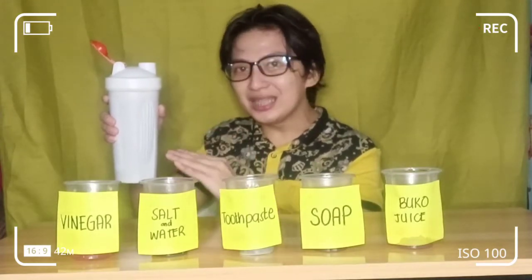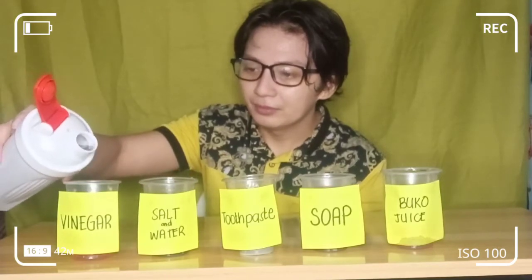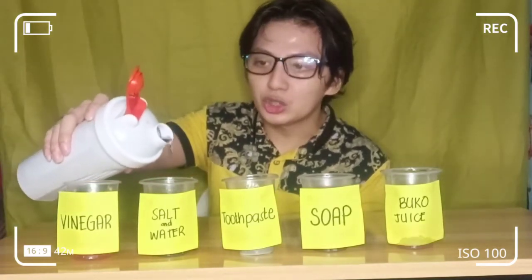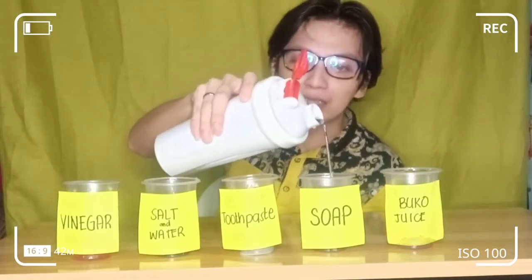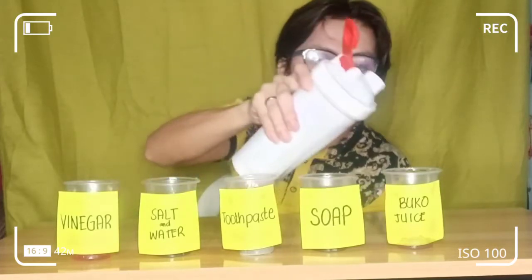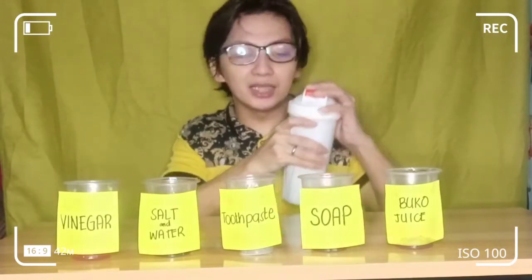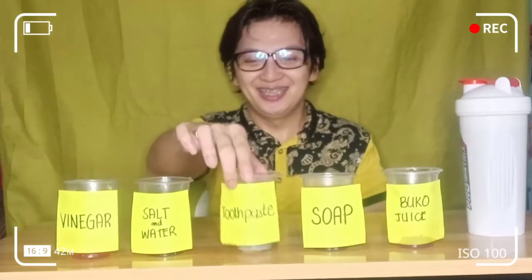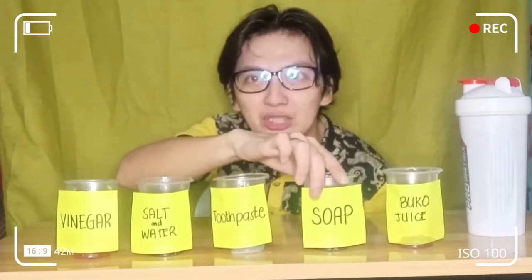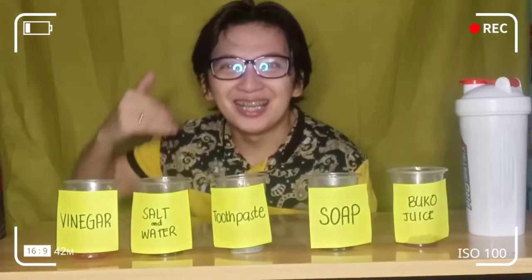Let's pour it very gently and very delicately. All we have to do is observe what color will appear — what observable color you will see in the different substances. We will just mix it a little bit. Let's just mix it, because I know you are very much attracted to colors, right? Because colors give life.